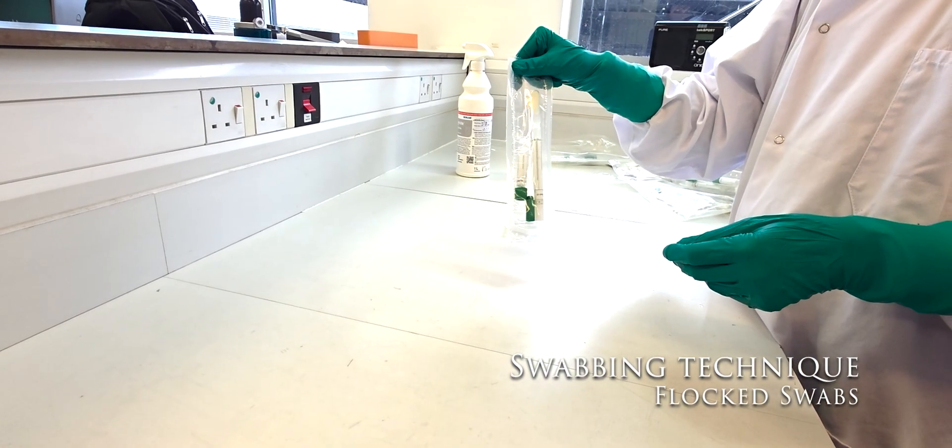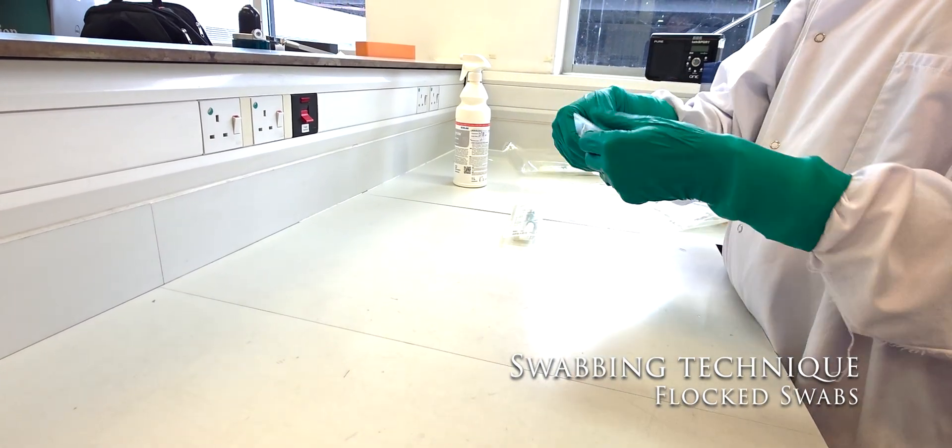When performing post-fill micromonitoring, it's important to make sure we're taking a good quality sample.